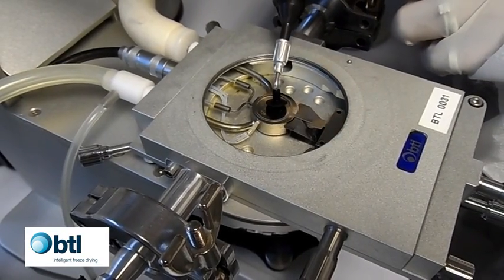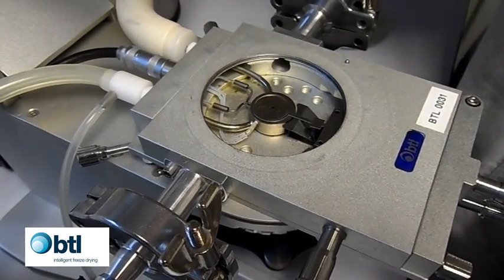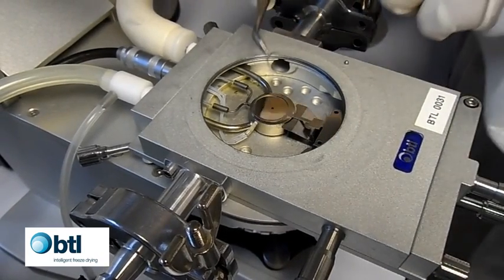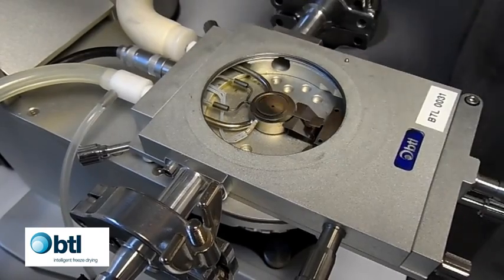Using the vacuum pen, place the quartz slide into the sample holder. With the metal forceps supplied, place the 17 micrometer spacer onto the quartz slide.